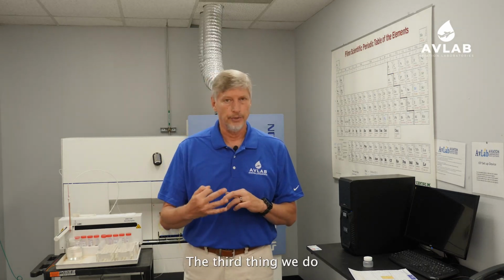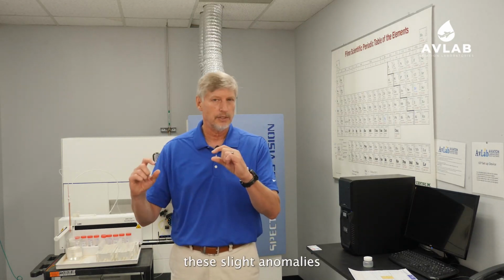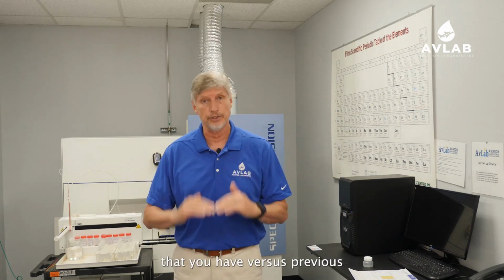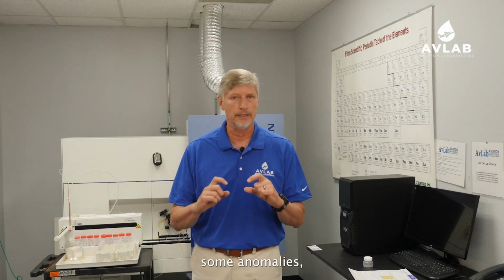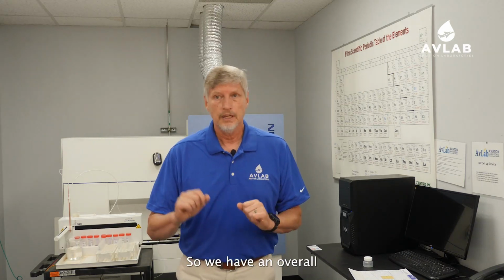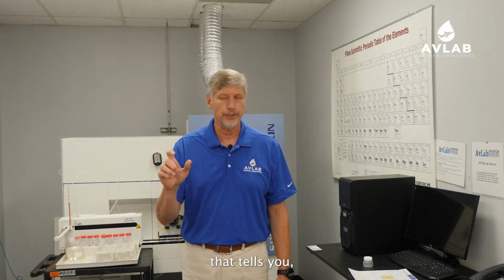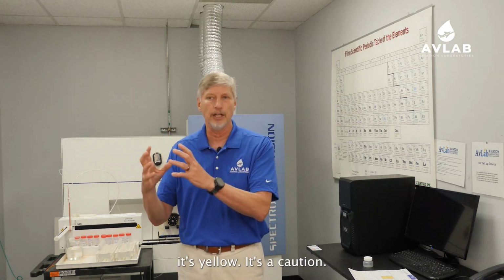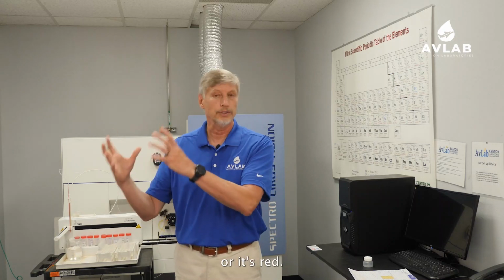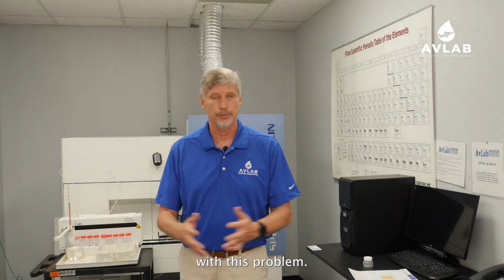The third thing we do is that we look at it more of a holistic kind of approach. We say, even though you may have these slight anomalies in the sample data that you have versus previous data or versus the average data, even though you may have some anomalies, they may not be a problem. So we have an overall, we call it an alarm meter, that tells you, your sample's green, sort of like a stoplight. Your sample's in the green, it's yellow, it's a caution, we need to be watching, or it's red. We've got a problem, we've identified a problem, you need to proactively deal with this problem.